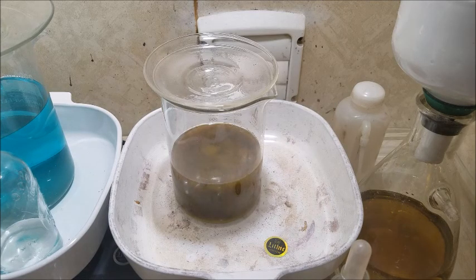The solution looks nice and yellow, with a lot of black iron residue left in there. Something's sinking down. I can't tell if it's the iron or, I don't know, if new precipitants are forming. I'm not quite sure. I'll be happy to filter it out.